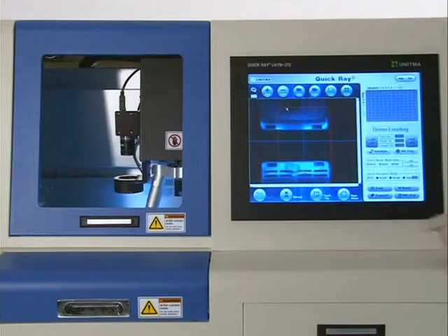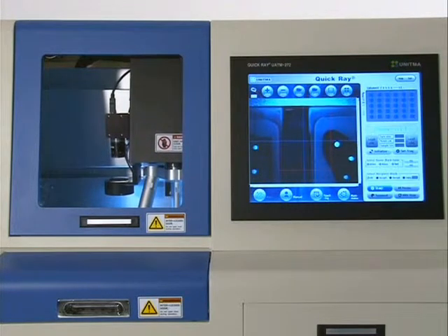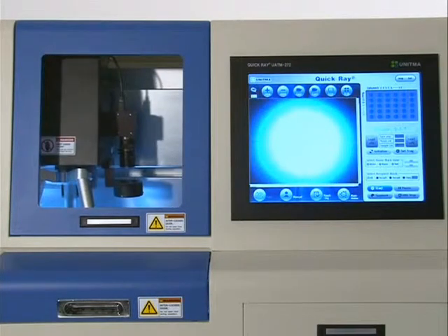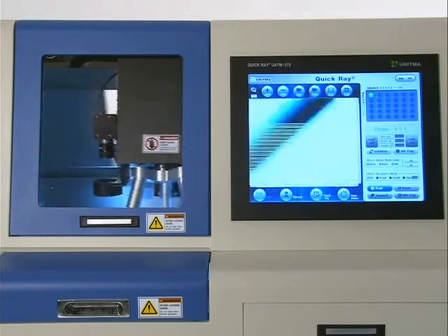Demo is the demonstration mode that shows the work that is the same as the actual operation status. The work of extracting and inserting a tissue sample is displayed via simulation. With this demo, a user can briefly identify the operation of this instrument.